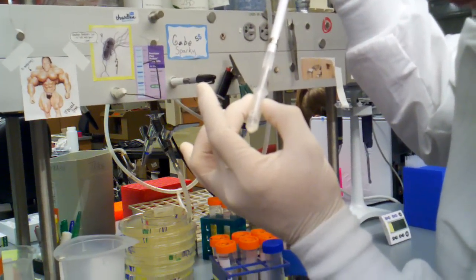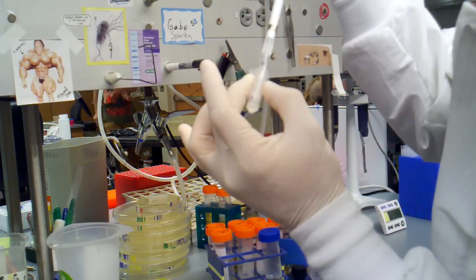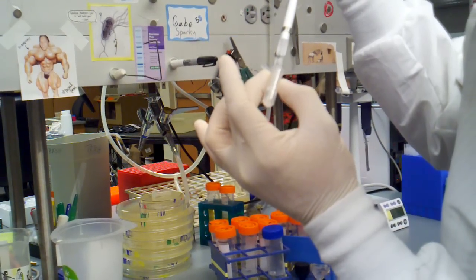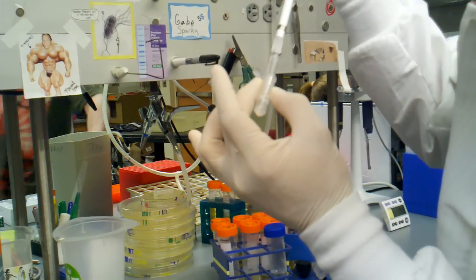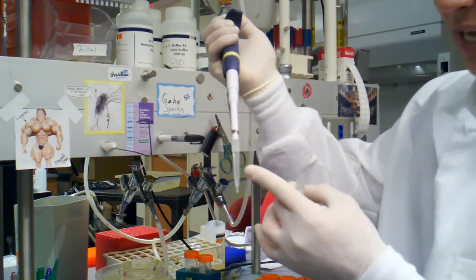I'm trying to pull up my liquid from the center of the tube, doing it slow so as not to disturb the pellet, which would then loosen up more of the junk that I don't want. You can see I have a pipette tip full of that liquid, and that has the plasmid DNA that we want.